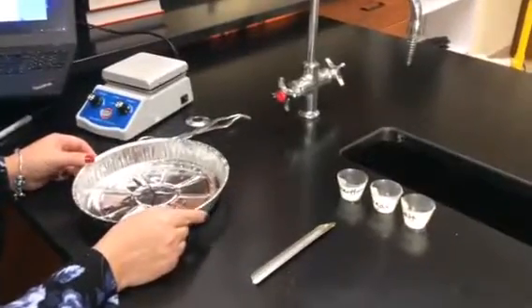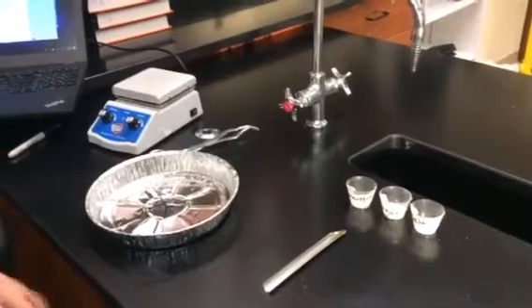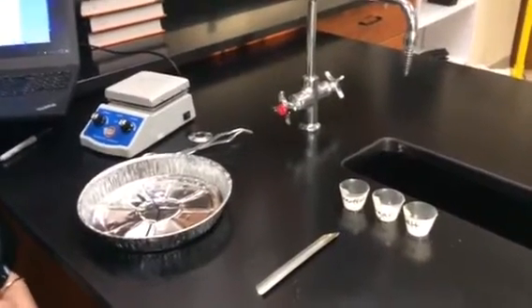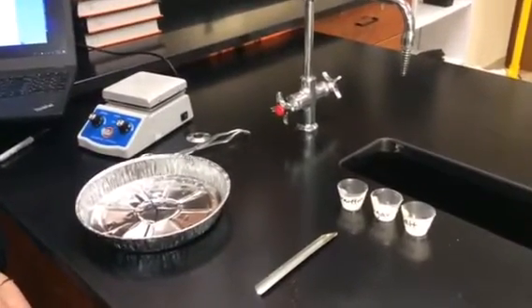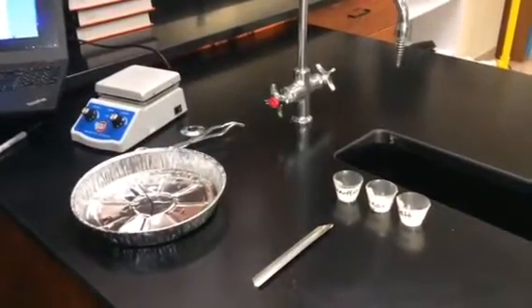All right, this is our lab for comparing ionic and covalent bonds. In the stuff that we've been doing in class, we've done a lot of looking at covalent and ionic and how they've been different, and so this lab is going to show us.